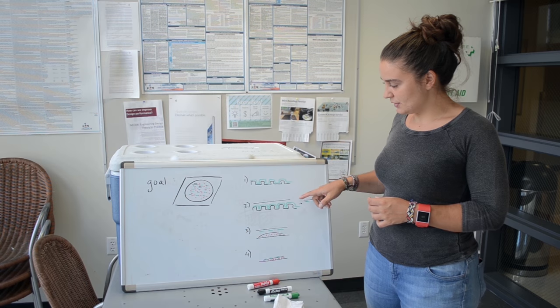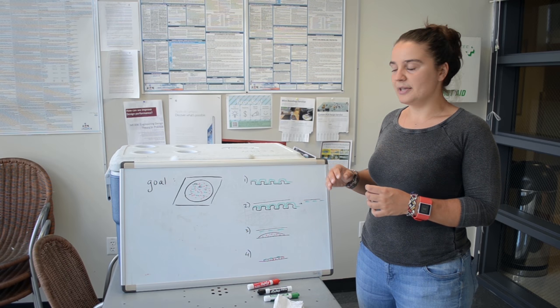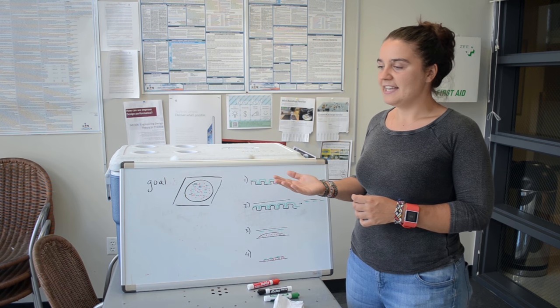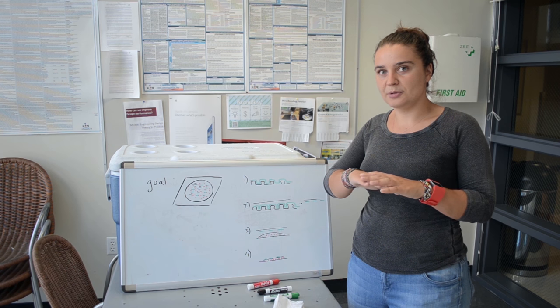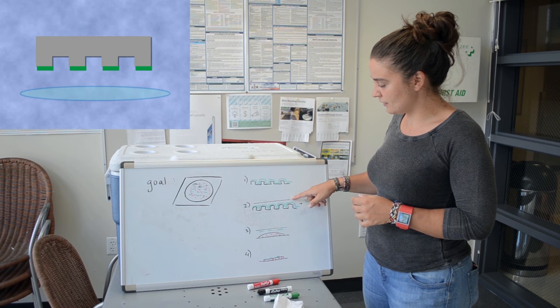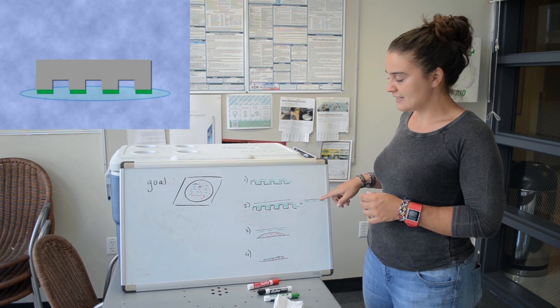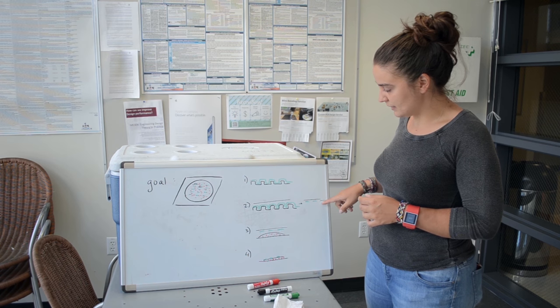And then what we're gonna do is take a piece of glass. So this is what this little line is. And we're going to treat it so that it becomes water-loving, hydrophilic, and proteins, because they're usually in water, are also surrounded by a hydrophilic coating. Making this hydrophilic or water-loving will allow us to get the protein to adhere to the glass. So that's what we're trying to get, like little islands of protein that is our stamp on the glass.